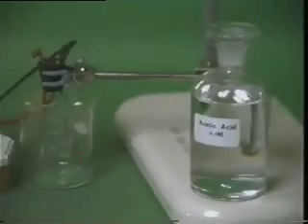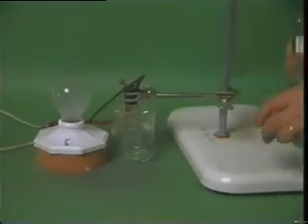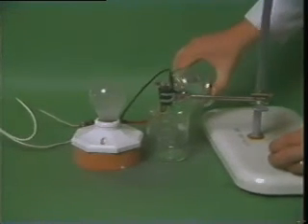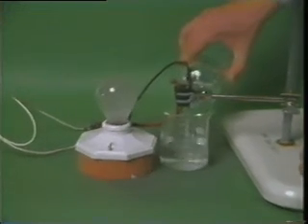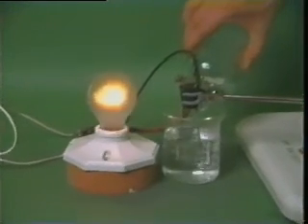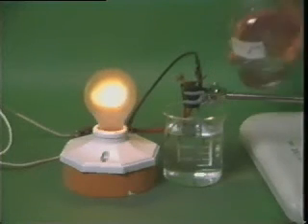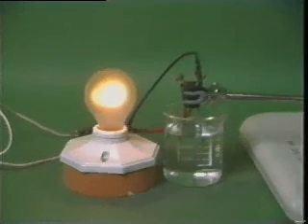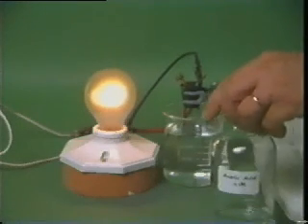In the last part of the experiment, we are using a weak acid: acetic acid. We pour 0.1 molar acetic acid into the beaker, and the light bulb glows less brightly, showing that the solution has only a small conductivity. Acetic acid is a weak acid and is only slightly ionized in water.